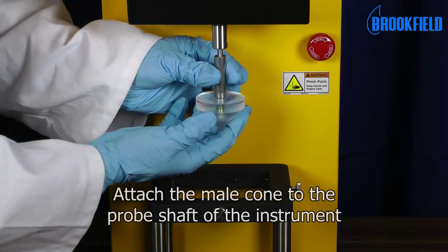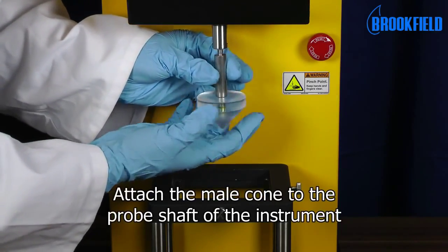To set up the test, attach the male cone to the probe shaft of the instrument.